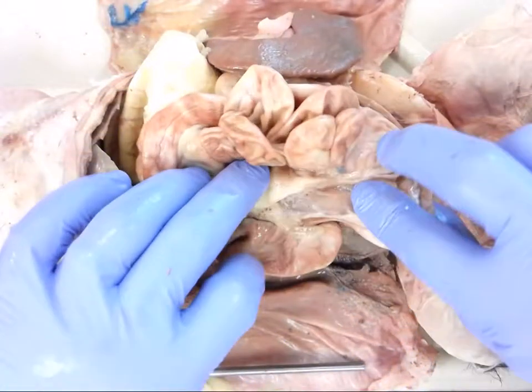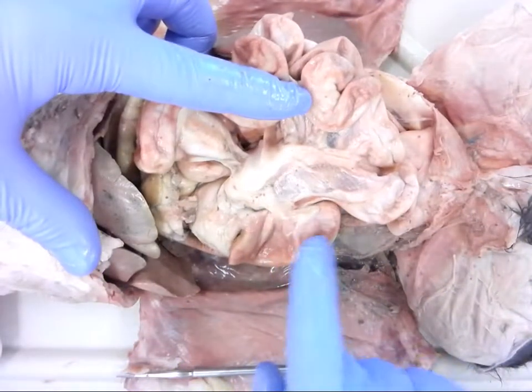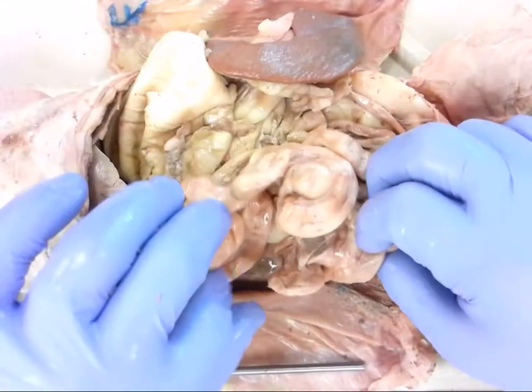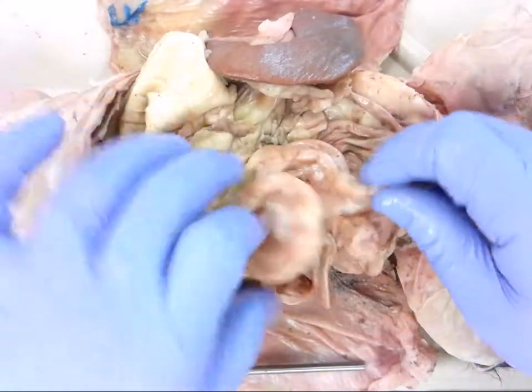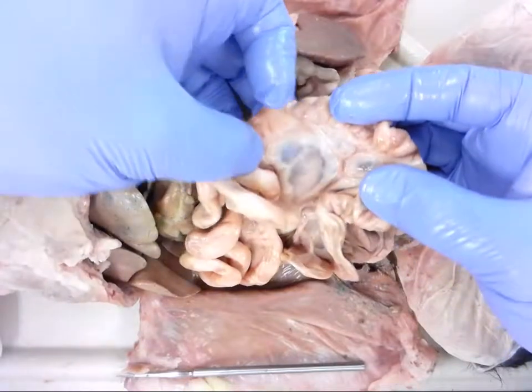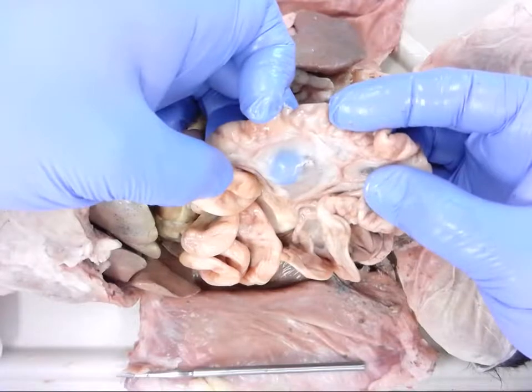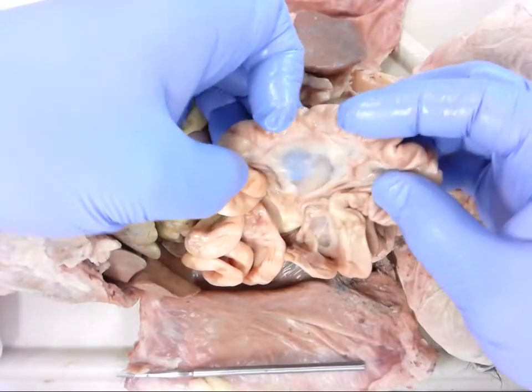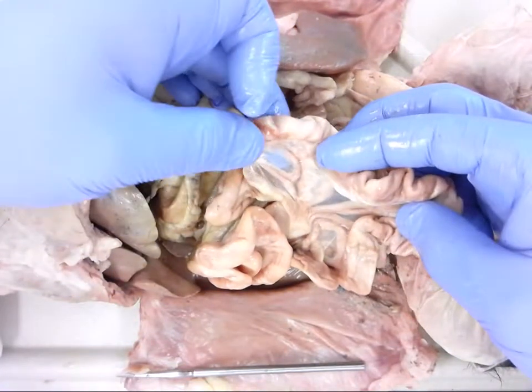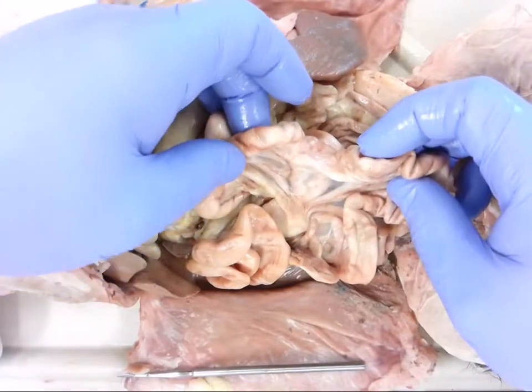You also see where the ileum enters the colon — there's a little part that hangs down called the cecum. One more note on the small intestine: it doesn't unravel well because there's a membrane holding it together. Running a finger on the underside, this is the mesentery, which holds everything together. It also carries blood vessels that supply blood flow to the intestines and assist in absorption of nutrients.